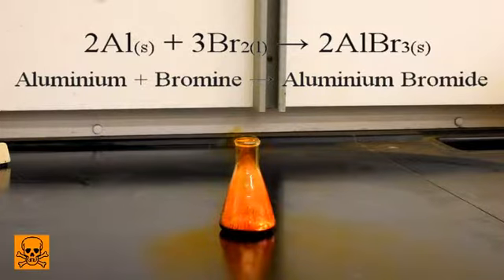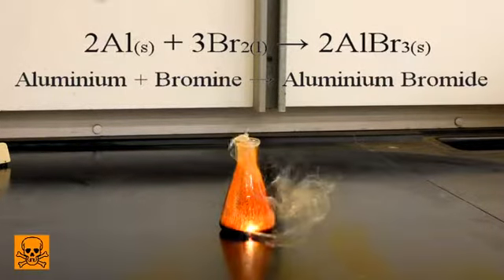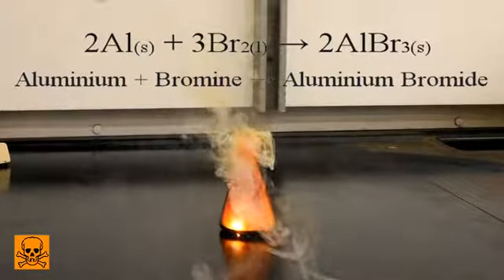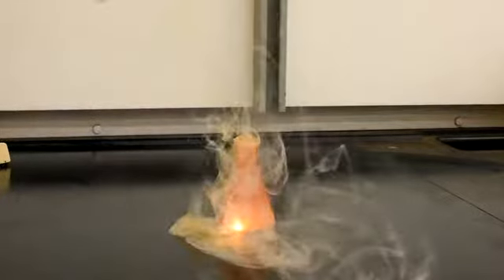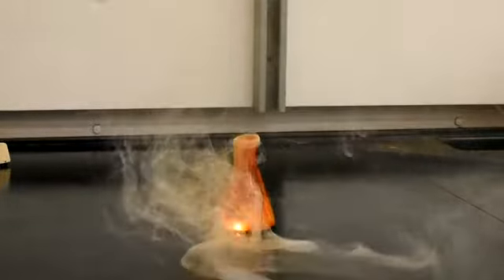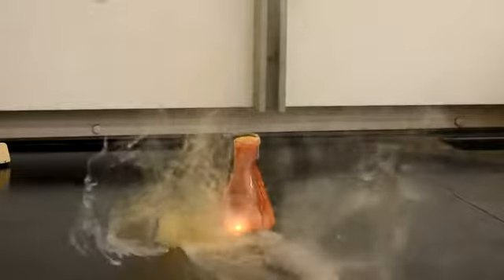And after a couple of seconds, you can see a reaction starts. And this reaction is aluminium reacting with bromine, forming aluminium bromide. We can see a white, sort of gaseous vapor being generated, which is exiting the top of the flask. This is a form of aluminium bromide.